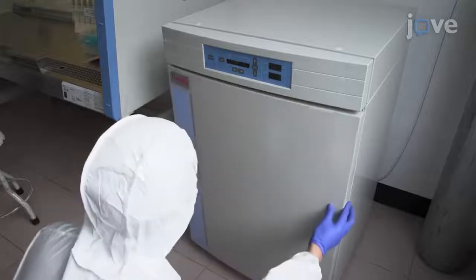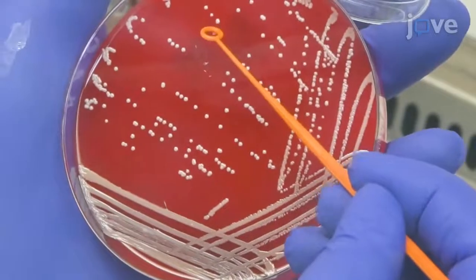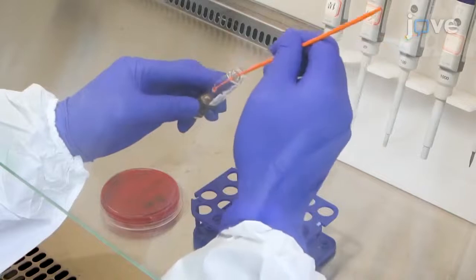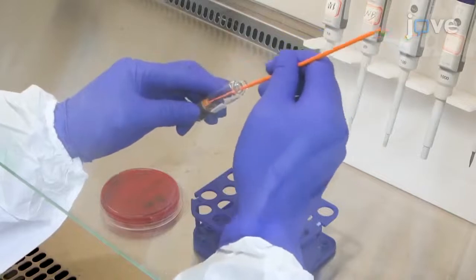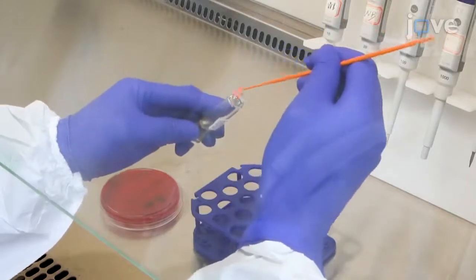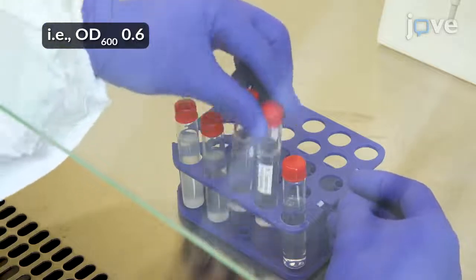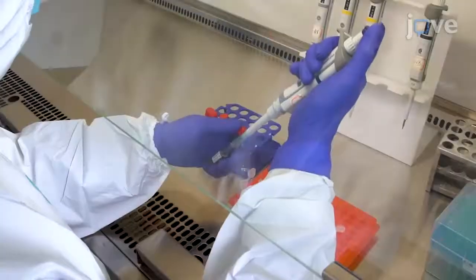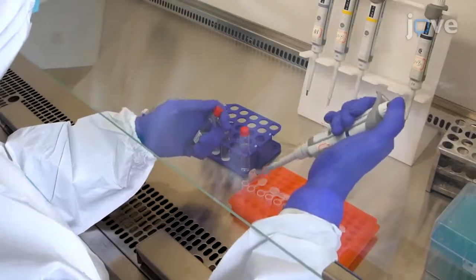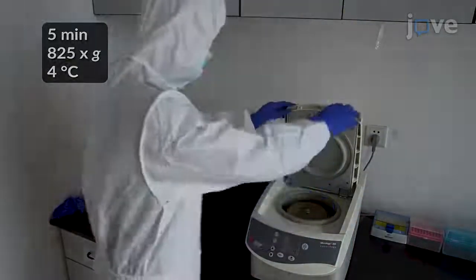The next morning, pick a single bacterial colony-forming unit for culture in tryptic soy broth tubes for 24 hours at 37 degrees Celsius. When the bacteria are in the mid-logarithmic growth phase, transfer 1 milliliter of bacteria into a 1.5 milliliter tube and collect the bacteria by centrifugation.